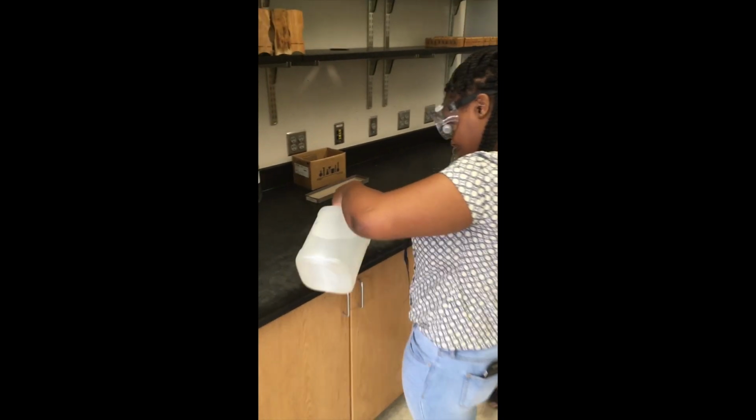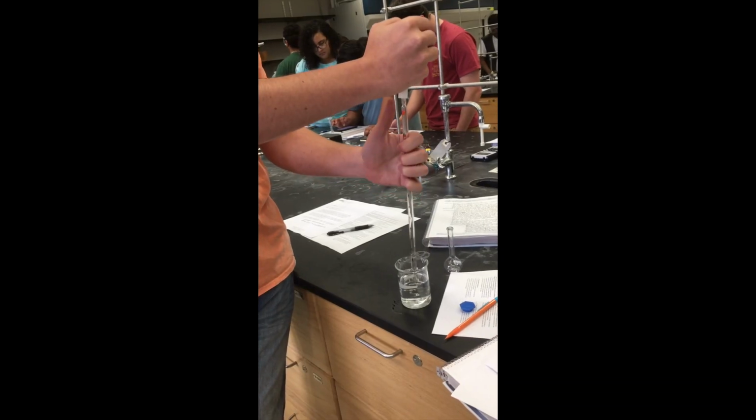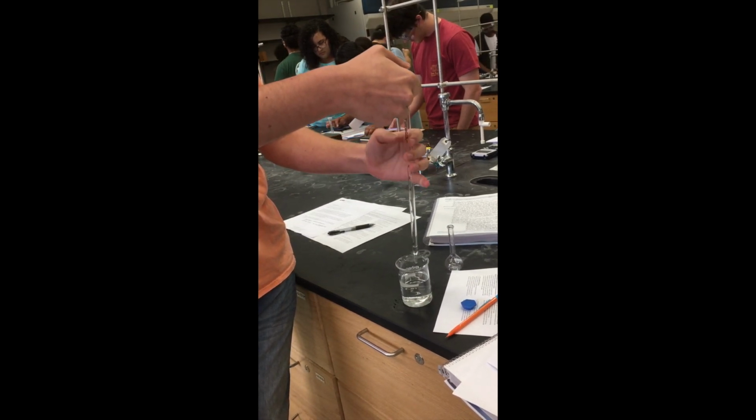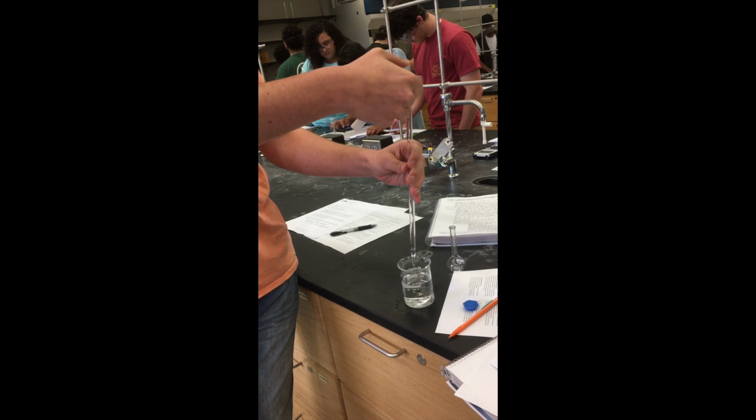When we begin this experiment, we want to transfer the stock solution from the stock container into a beaker for pipetting. Before using the pipette, we need to rinse it 3 times with water and then 3 times with the solution to rinse out any water. Make sure to squeeze the bulb before placing it on the pipette.